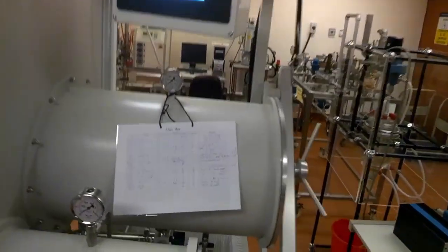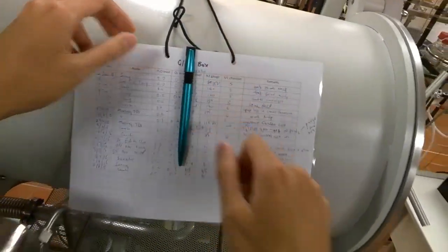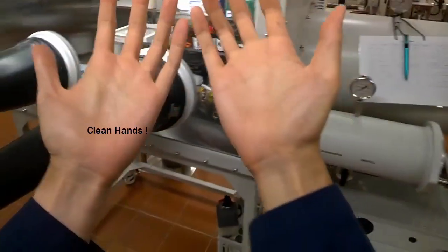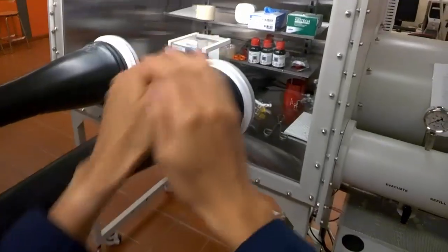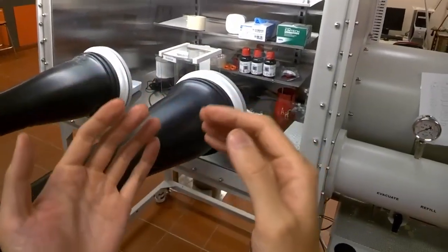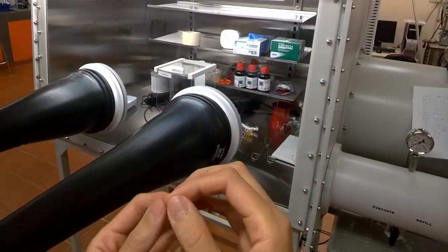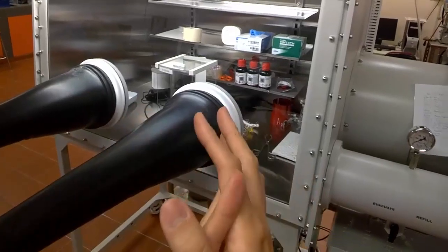First up, before you put your hands into the box gloves, make sure that your fingernails are not too pointed. You do not bring any kinds of jewelry, accessories, rings, watches, because this could spoil the plastics and puncture the rubber gloves and deflate the whole system, which renders the whole system useless.